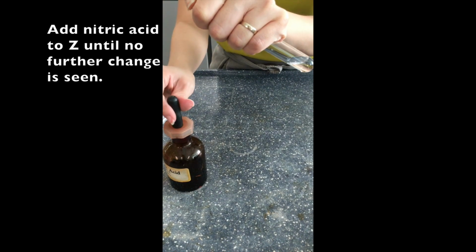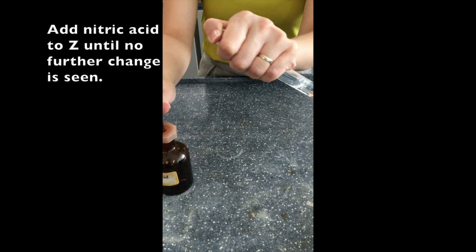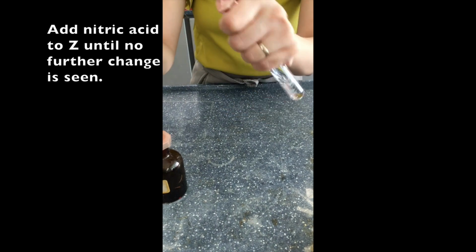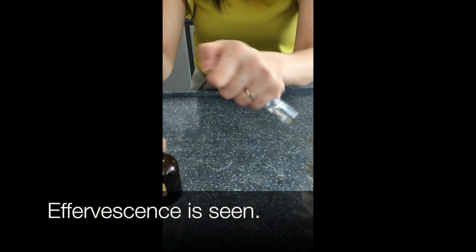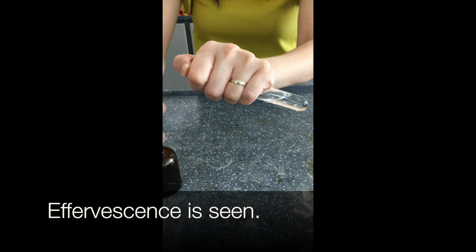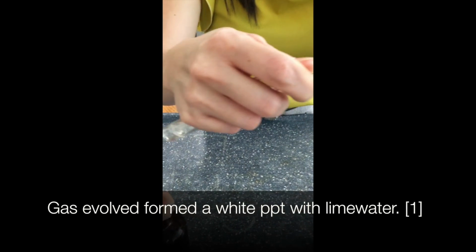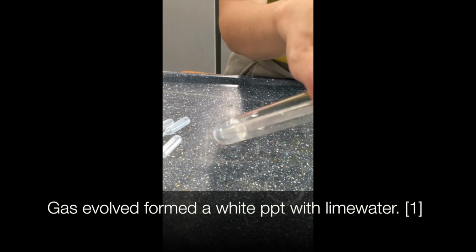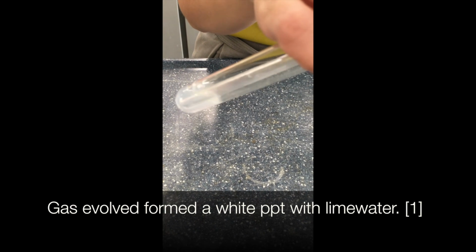Okay, next, this is done for Z. Again, there is effervescence and there is gas being produced. Therefore, we trap the gas in the test tube. And we continue to add until no further change is seen. So the first observation that we can tell is there is effervescence. So we add as well up to 1/3 of the test tube, or even slightly more. Then we bubble the gas through lime water. And this would then be the second observation, where white precipitate is formed.